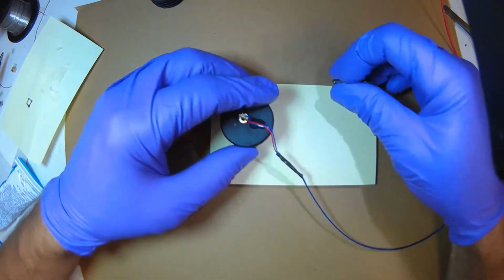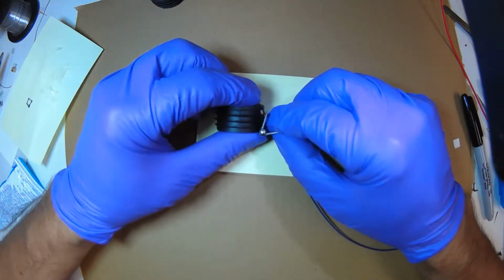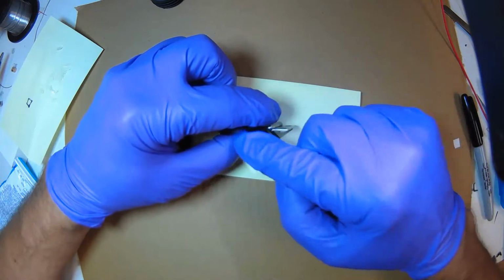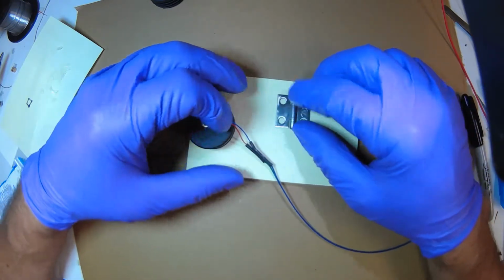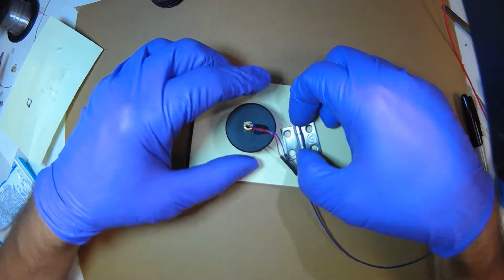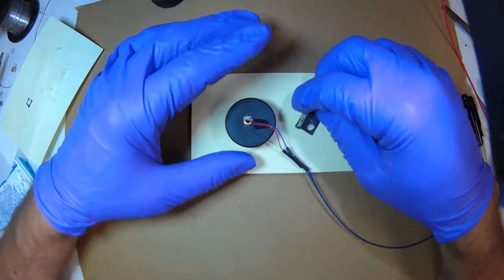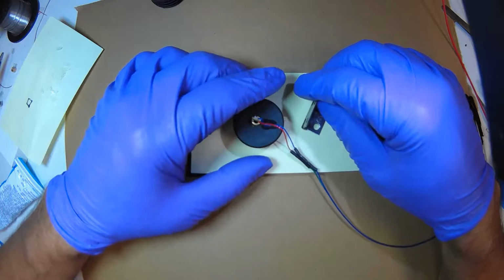What's really important is that the hinge be at the right height. If it's up here, it's not going to hit the board very well. If it's too low, you'll have a gap where light will come in. So you want the hinge flush to the plane of the bottom of the cylinder. To do that, I'm just going to use a card. You can use cardboard. You're going to get hot glue on it, so you want something you can throw away.